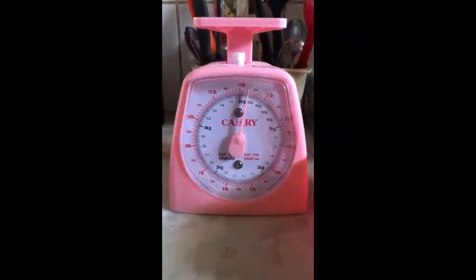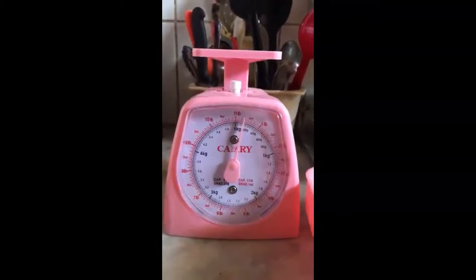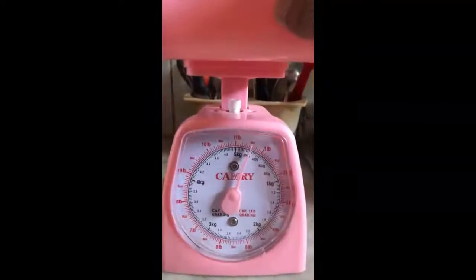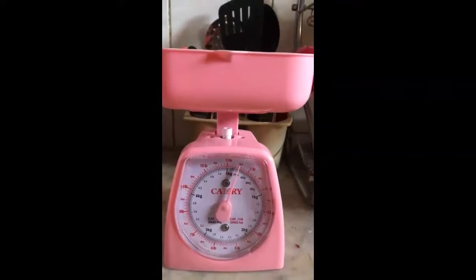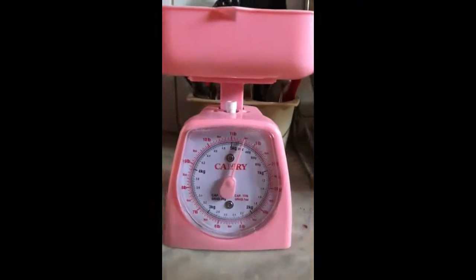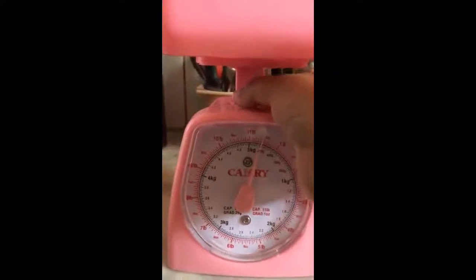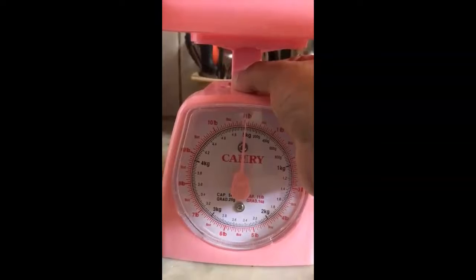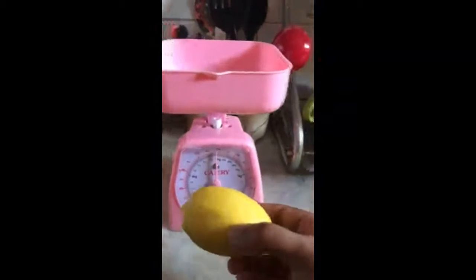Hello my dear students, here you can see the balance, right? Now you can see the needle of the balance, and here I place the pan on the top, so it is called a top pan balance, used to measure the mass. Now you can see the needle is not at zero, so we have to reset it, otherwise our measurements will be wrong. Always check if it is at zero or our measurement is wrong.